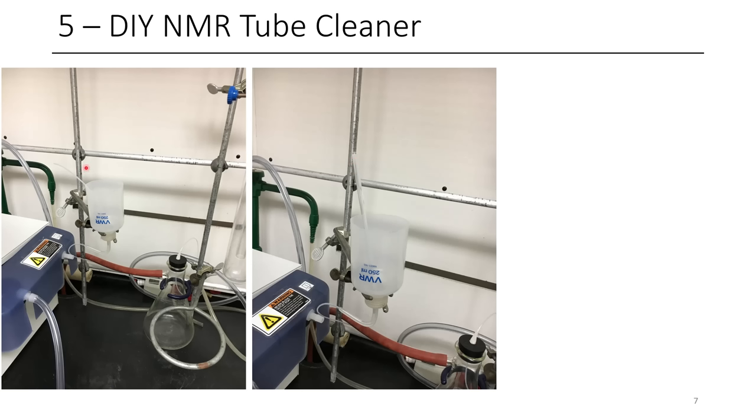OK, and so what happens is if you run this PTFE tubing into the top of a flask with a sidearm, what can happen is when you pull a vacuum on the sidearm, it will actually just pull a vacuum through the whole flask through that PTFE tubing and through your NMR tube.